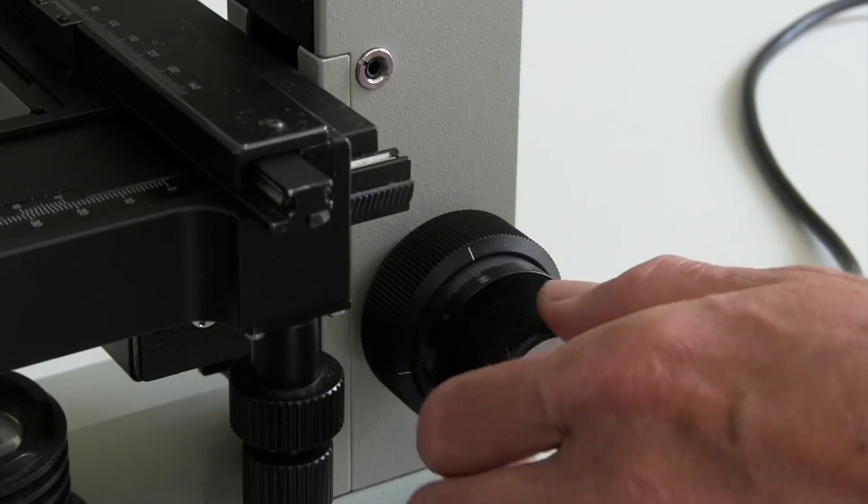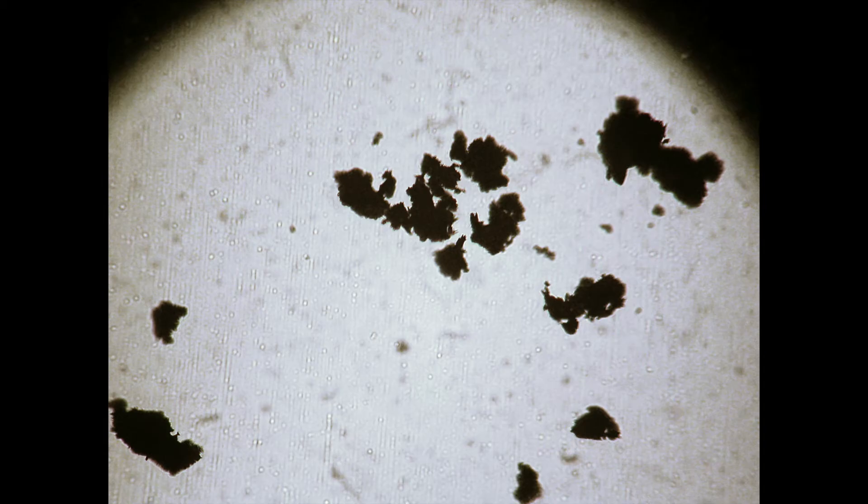Then use fine focus, the outer knob which is easy to rotate, to get your mark sharply focused. Make sure that the light intensity is bright enough to see clearly, but not so bright so that you dazzle yourself.